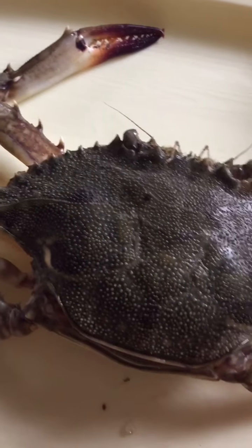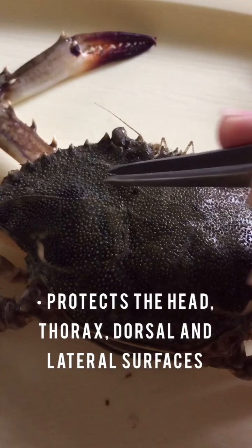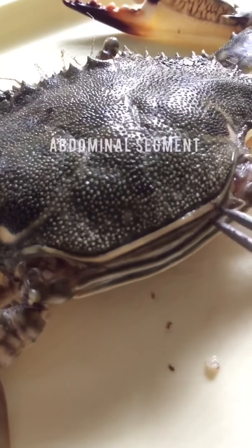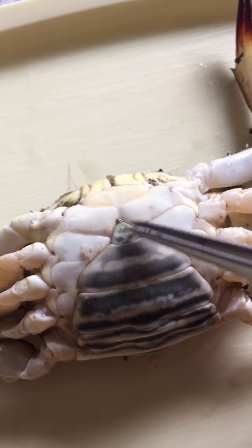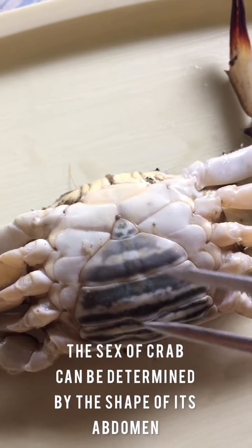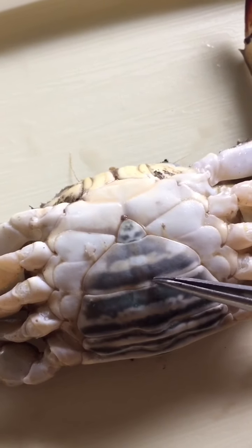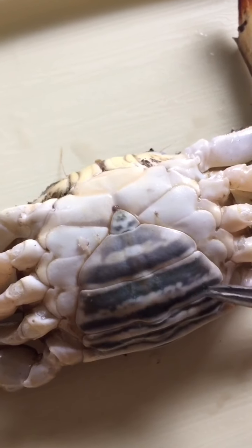The whole outer shell is what we call the carapace. The carapace covers the head and thorax and protects the dorsal and lateral surfaces. What we see here is an abdominal segment, and this is the crab's abdomen when we lift it back. You can tell the sex of the crab by the shape of its abdomen or tail flap — a thin triangular apron for a male, while the female's is larger and rounder. So it is actually a female crab.